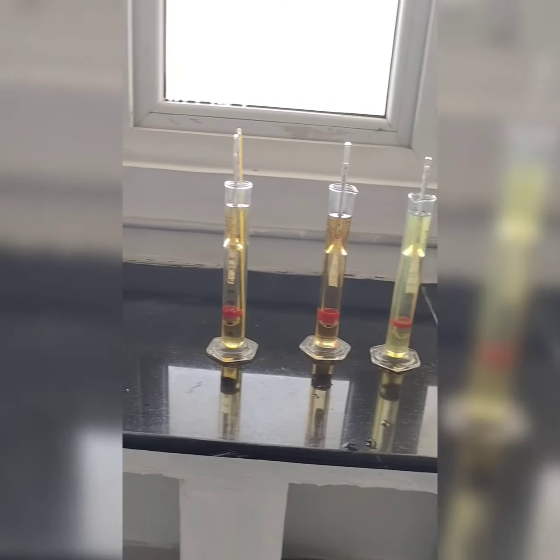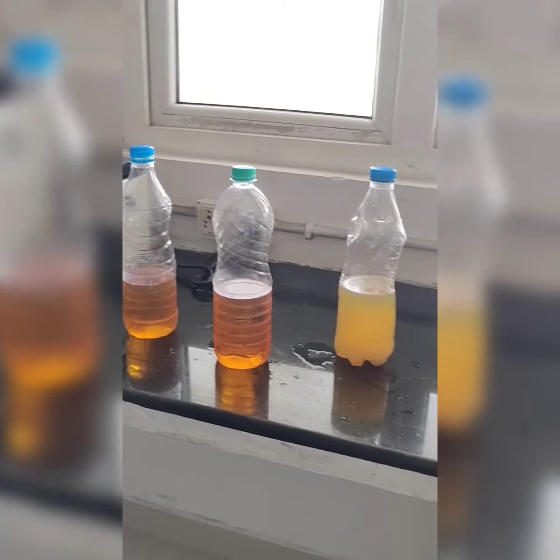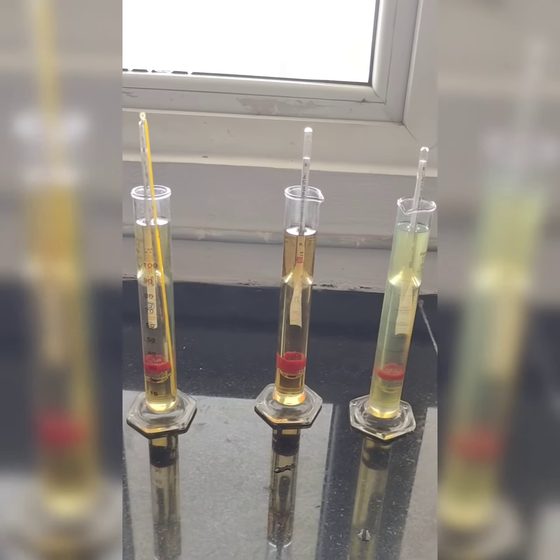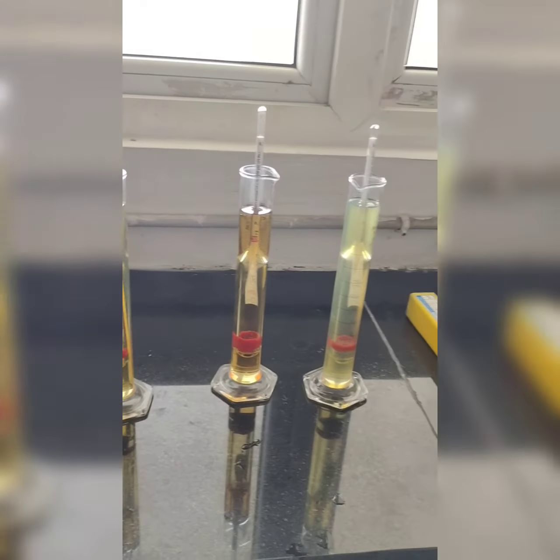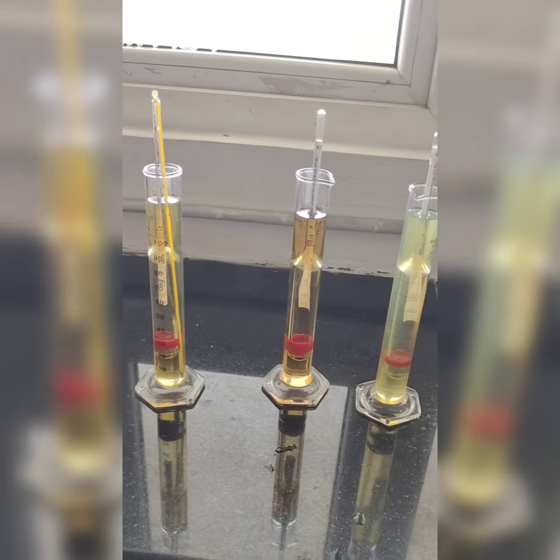So this is how we do the density examination of petroleum products by using the samples which we get from the petrol bunks, and this is how we get the results. You can note down these results as part of your practical, as you do not have time for doing the practicals and many students are there. So I guess it will be useful for you.